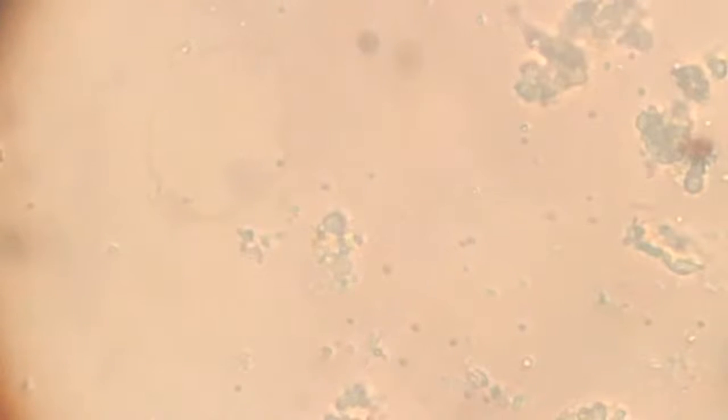I hope you can see that. There. There you see it's now throwing away another pseudopodia and going towards 7 o'clock direction. Alright, now we are in a better position to see it.